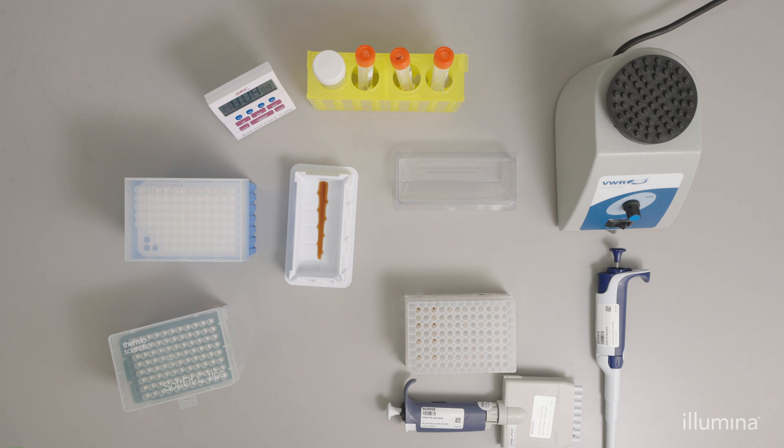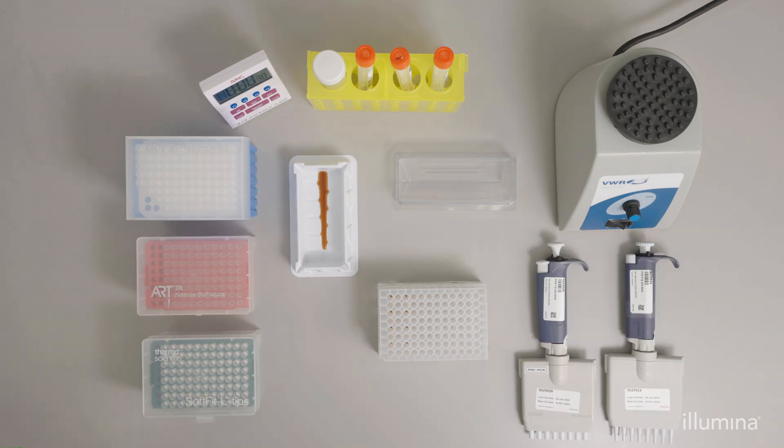Keep a few points in mind when adding samples to the MIDI plate. Place samples every other column so that the pellet collects on the same side for each column. Odd wells work best for right-handed pipetting, even wells for left-handed pipetting.